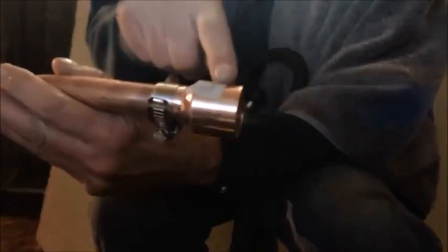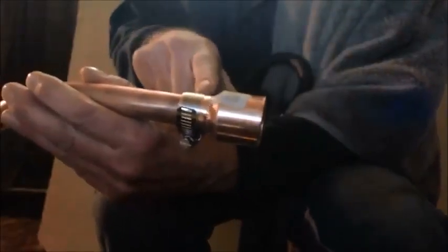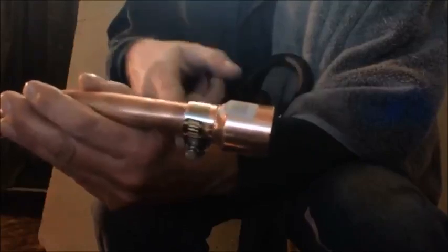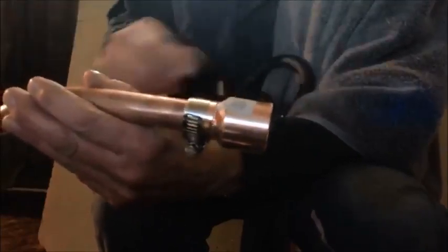But you can see it has the thing that comes out. I'm going to cap here. I'm going to epoxy that. And then when I, you'll see on the end of this, this is one piece here. It goes, it's a reducer. It goes from, there's no threads or anything. It goes from here to here. And then I got a clamp on there. And then I'm going to epoxy it right here. And then I got this, like I said. Let me tell you, I need to like hammer this in. This is nice and snug, this fitting here.